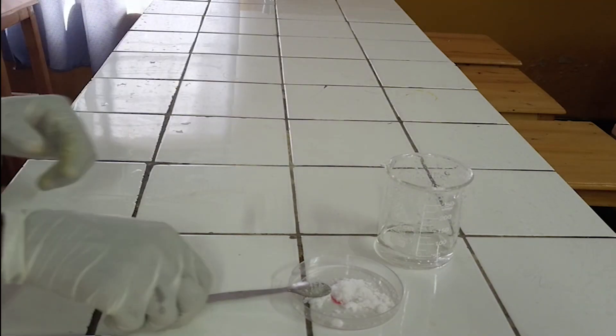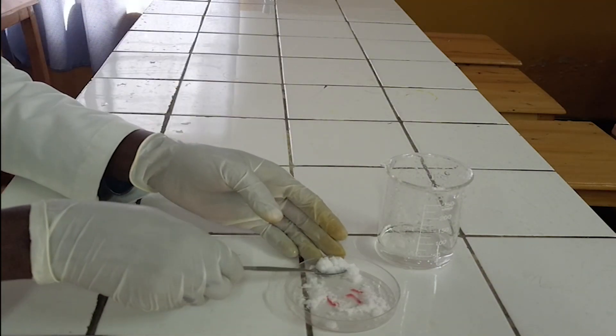First step, dissolve a full spatula of salt in 50 milliliters of water.